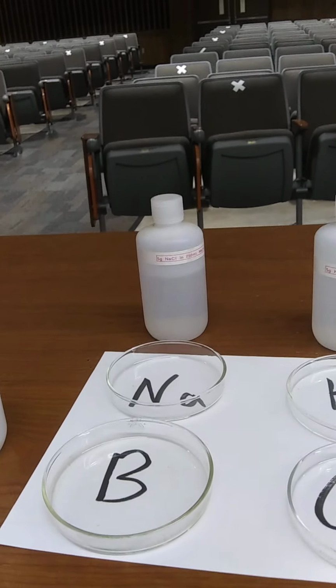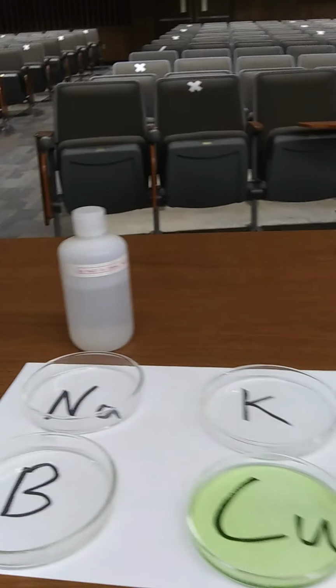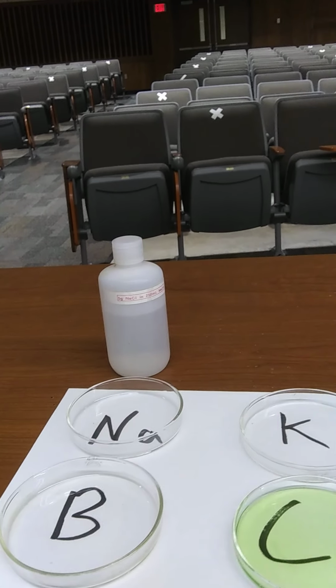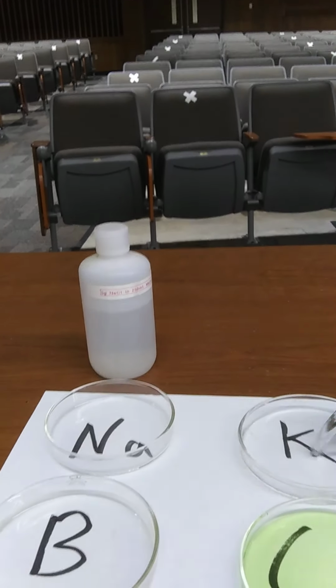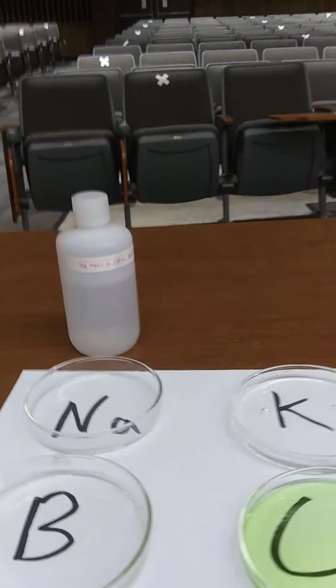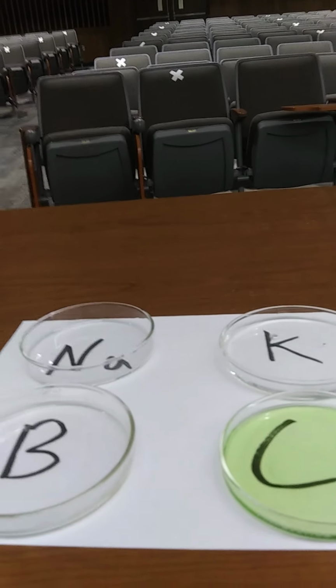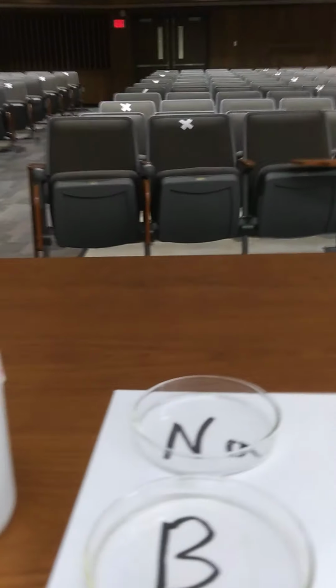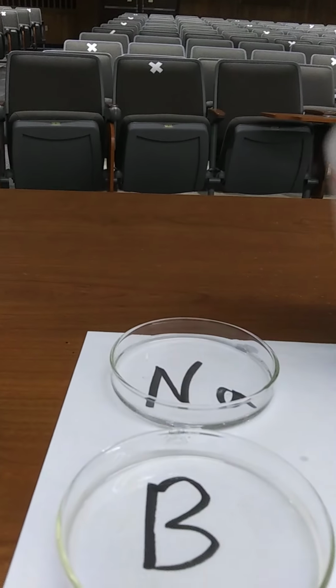Probably should have done that before I started it. And what we're interested in is the electronic states of these atoms. Where are the electrons in orbitals on these atoms? And how do those, this one's a little tight, hold on. Very high production qualities here. And so how do those electrons interact with light and energy?